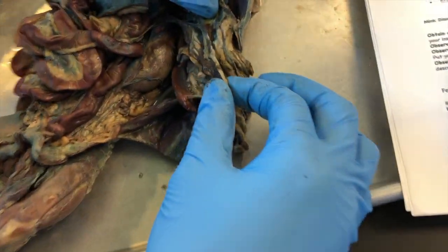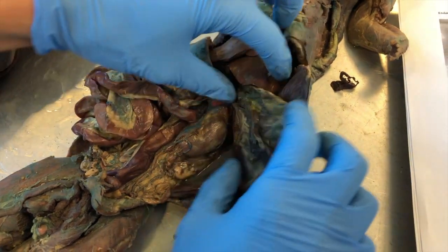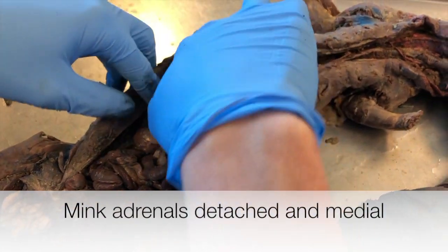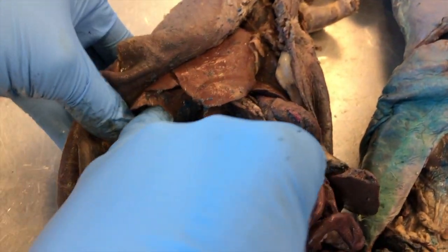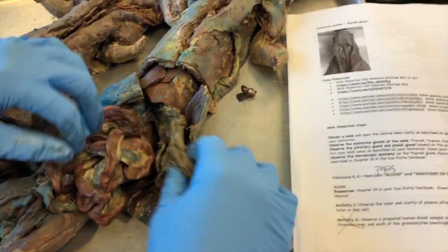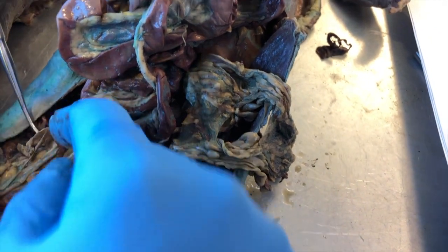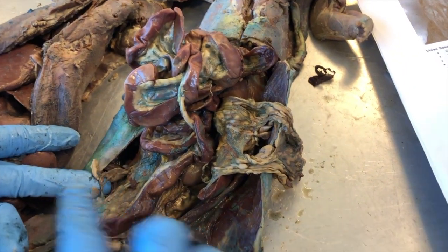For the adrenal gland, the biggest marker is the kidney — the bean shape. In humans the adrenal gland sits directly on top of the kidney. Find the kidney and go up and toward the center to feel two hard nodules — that's your adrenal gland. For the ovaries, look for the horns — these attach like that, though in this specimen they're broken.